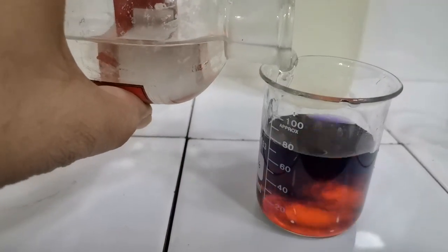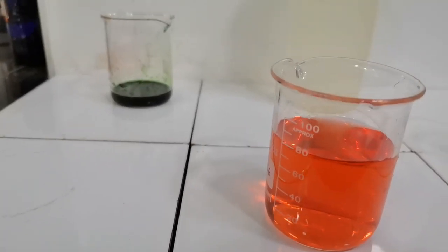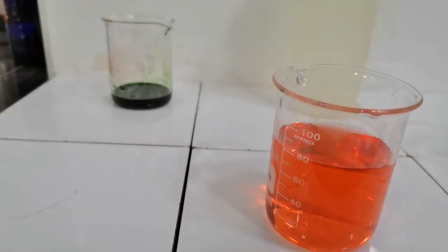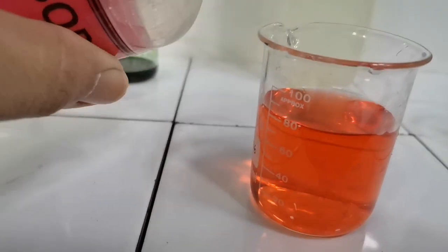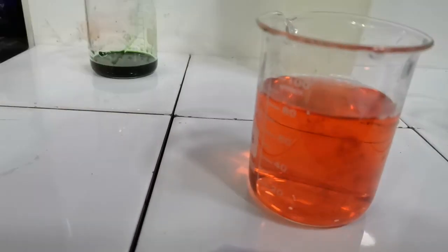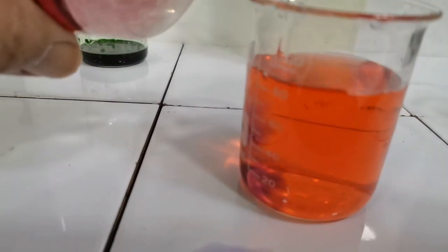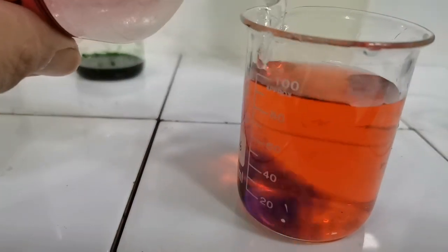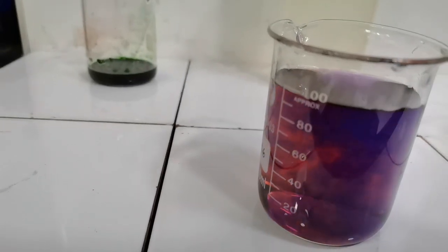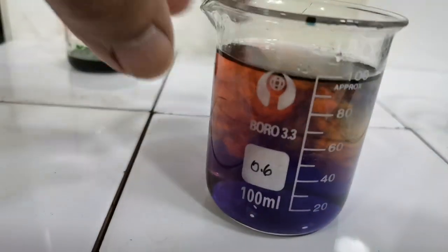Adding sulfuric acid, the purple color disappears and the red color is deeper now because we have more of the universal indicator in this solution. And finally adding sodium hydroxide. First the acid will be neutralized, which you can see happening, and then after the acid has been neutralized, we will get back the purple color. Here you can see that finally the acid present is being neutralized.